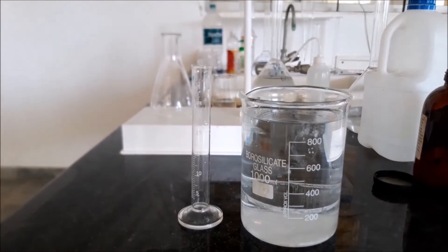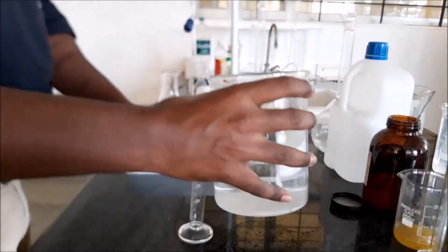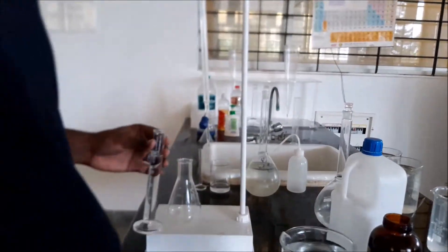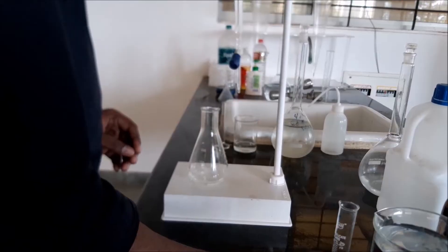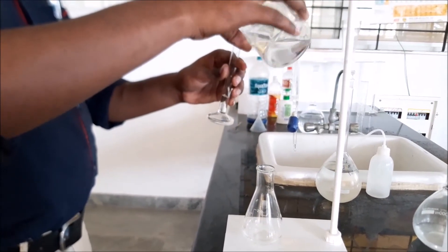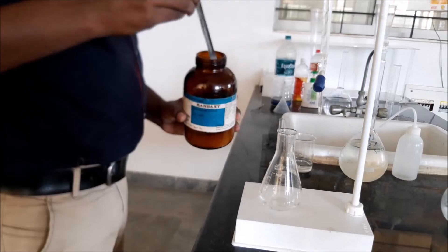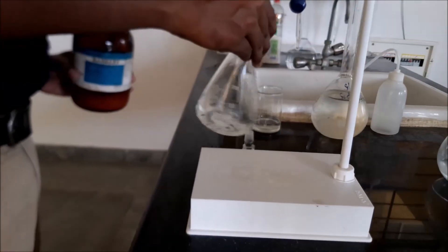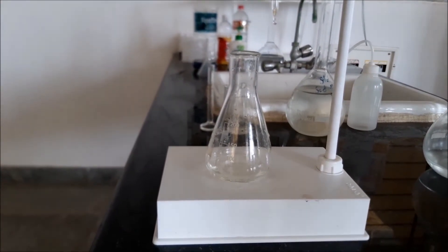We have taken the third sample, to which six ml of chlorine water was added. We take 25 ml out of this and add it to the conical flask. Two ml of acetic acid is added, followed by a pinch of potassium iodide. Again, as you can see, there is no change in color, signifying that there is no residual chlorine. Note down the value as zero.